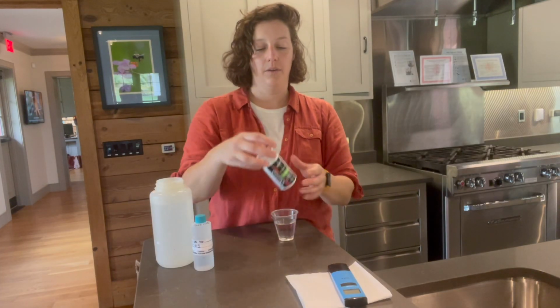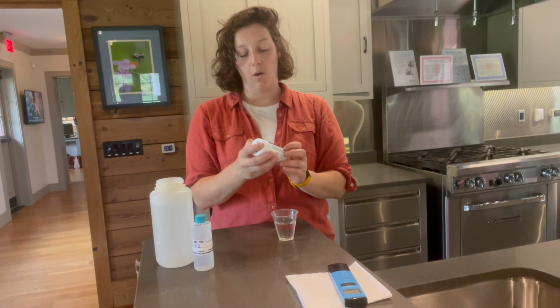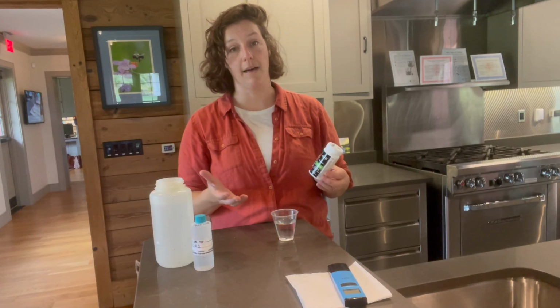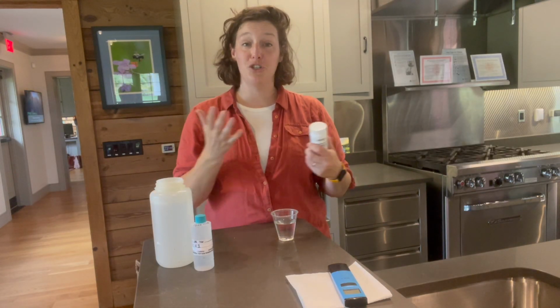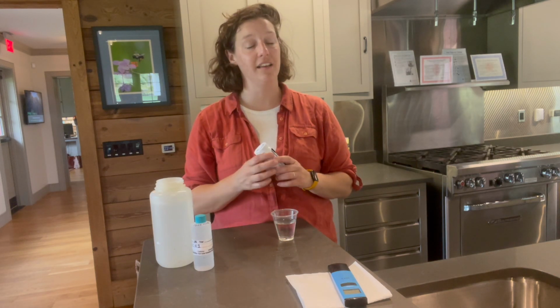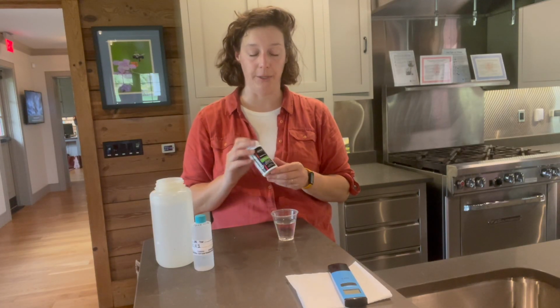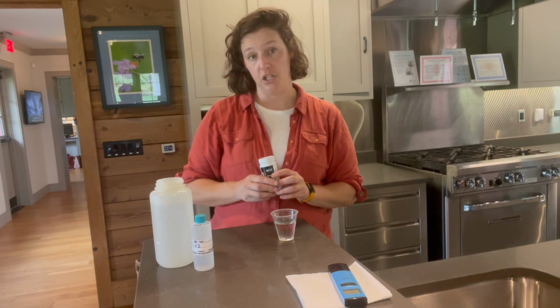Next on the docket will be our chloride measurement. So we're using the Quantab low range chloride strips. And the low range is important because we're measuring salt levels in a freshwater system. The upper limit should not be exceeded, but we have definitely run into samples that were collected after winter storms that have salt levels higher than what our strips can measure. But if you're collecting at base flow, that shouldn't be an issue that you run into.